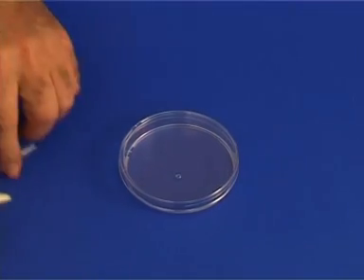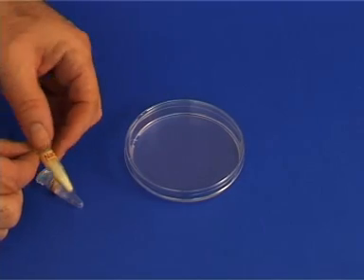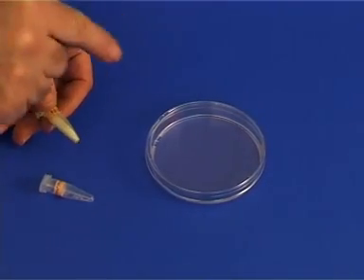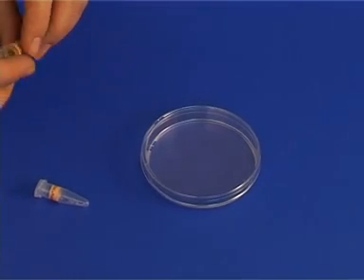You should also have two small vials, each containing a different kind of crystal. One contains sodium chloride and the other sodium acetate, which was used to prepare the solution.